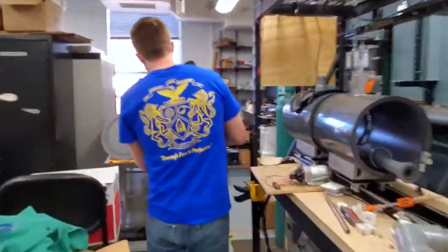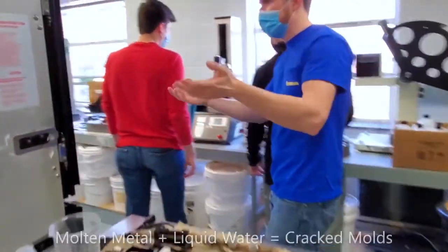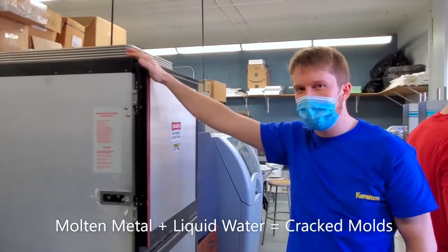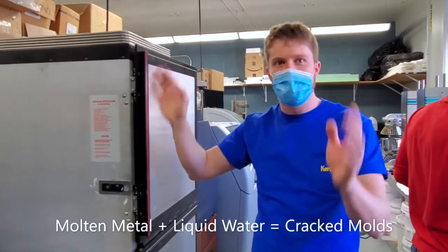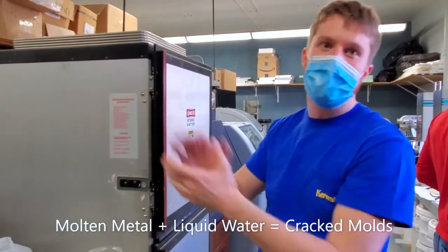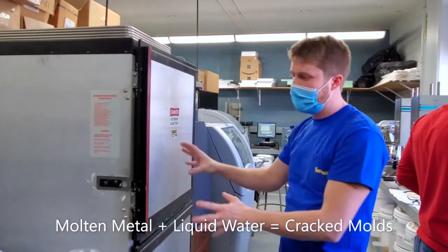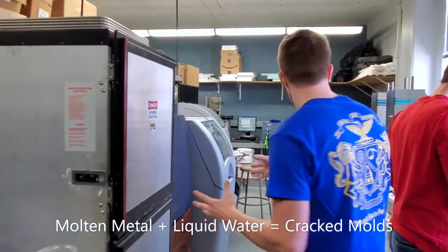The next thing back here that I'll introduce is this. This is basically our oven. Anytime we're making molds for casting, like gypsum molds, we have to heat them up to drive all the water out, because you don't want to take something that has water in it and put it in a furnace that's hundreds of degrees, because the water will boil and crack your mold. So this is how we can heat it up to about 100 degrees Celsius and drive all the water out before we put it in a furnace that's going to be much hotter.